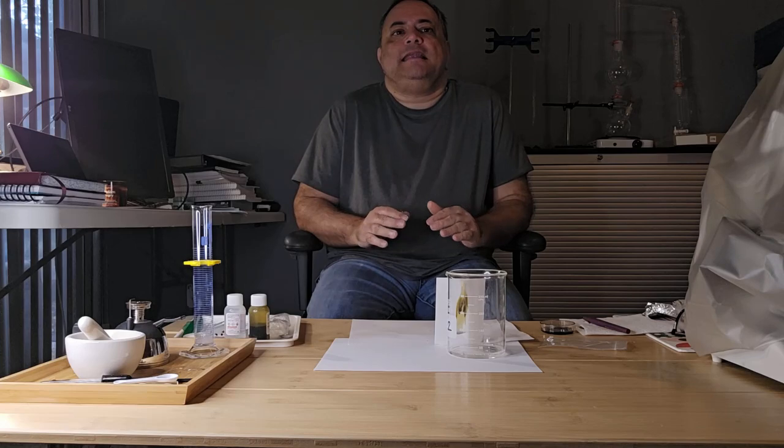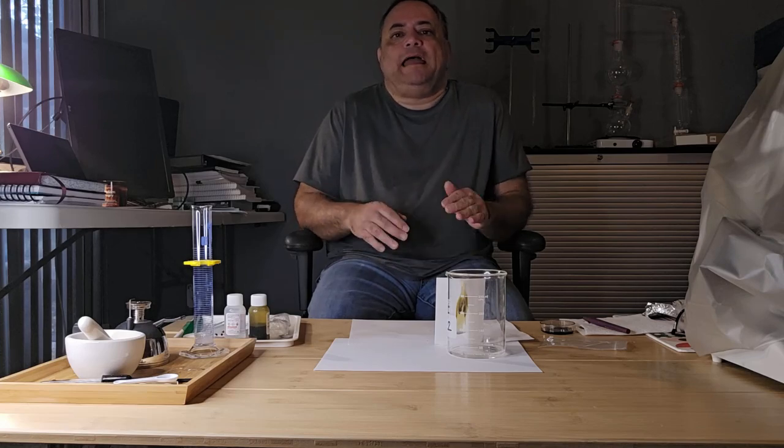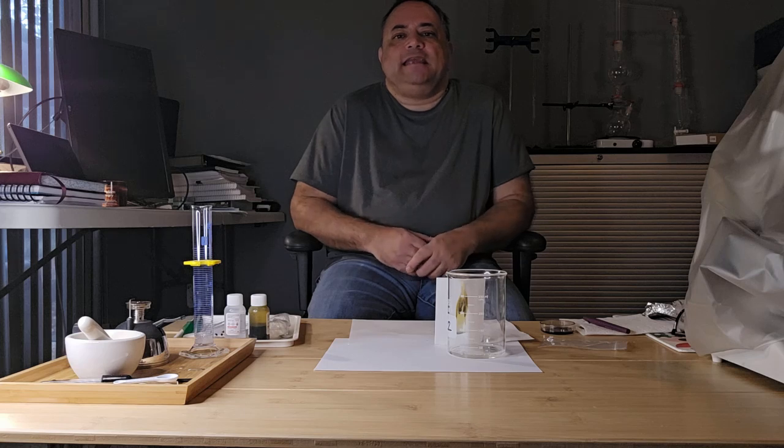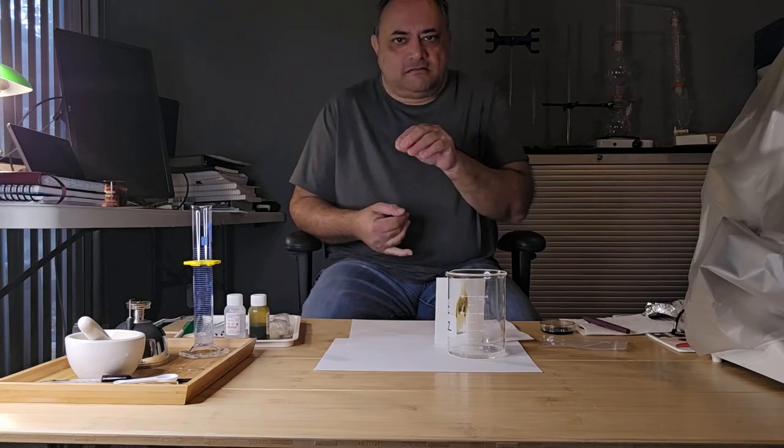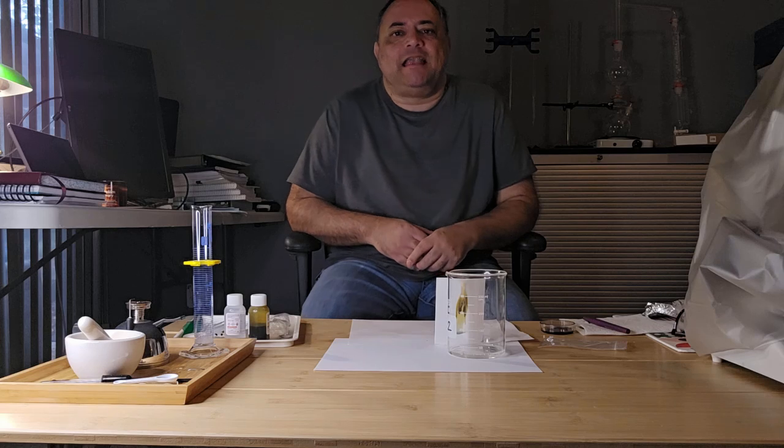So the quality of your separation and the neatness of your bands, there are many factors that can contribute. For example, you could apply too much of your mixture to the application line.